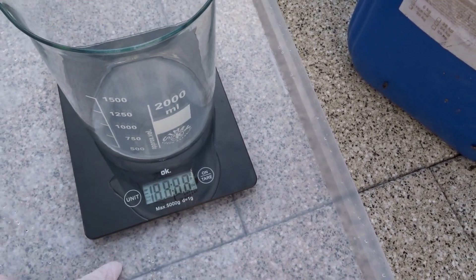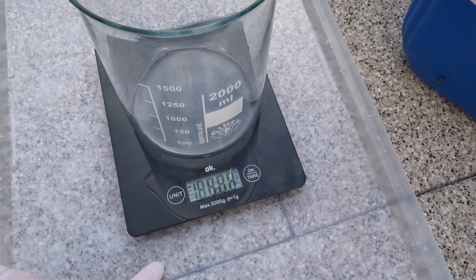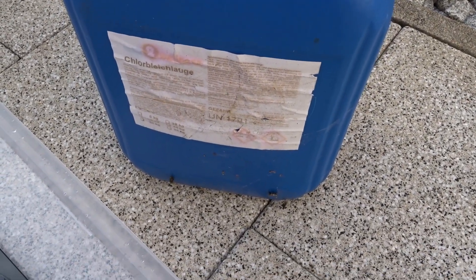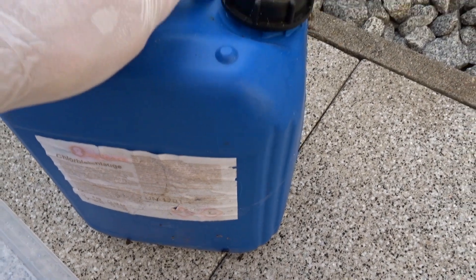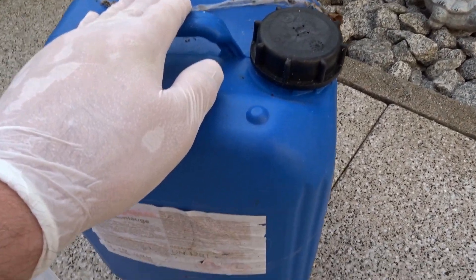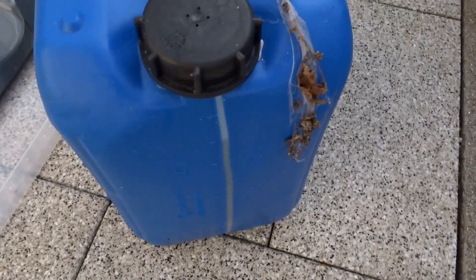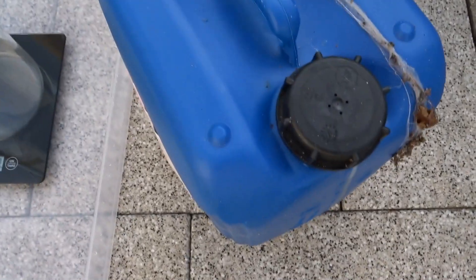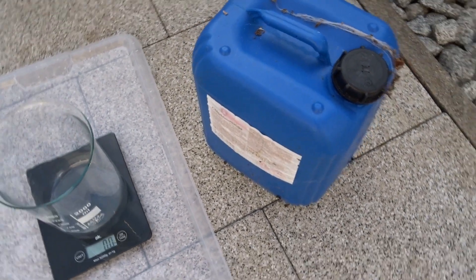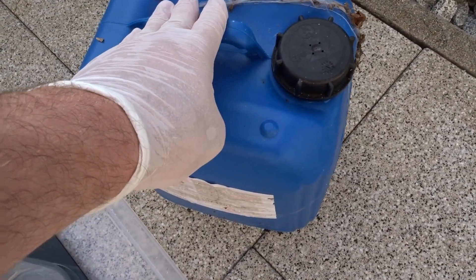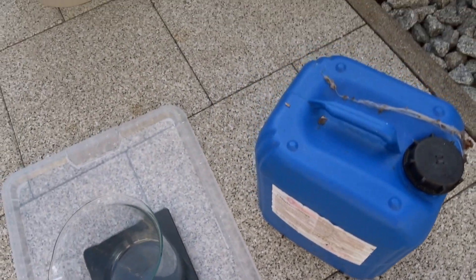So I'm going to start with 1.16 kilograms of bleach. This is the 12% stuff, the more concentrated bleach which is industrial grade. I bought this quite a while ago and I have plenty left. I suppose I just bought it because it was so cheap in bulk and I don't need it anymore. So I'll probably convert most of this to chloroform, but today just 1.16 kilograms.